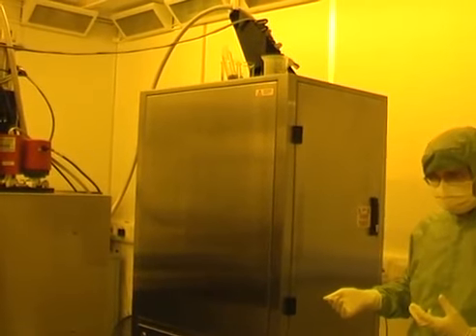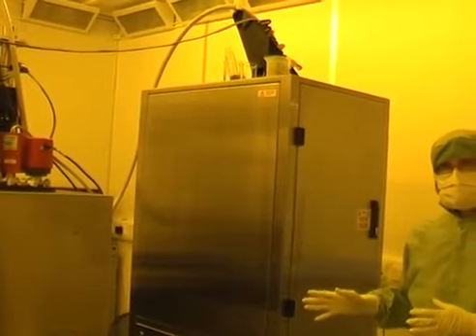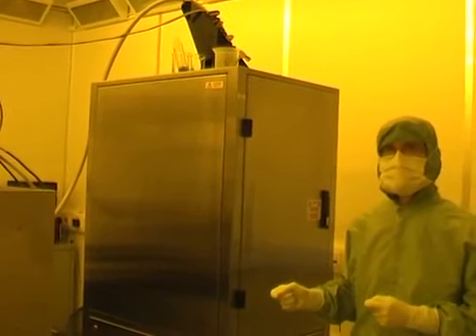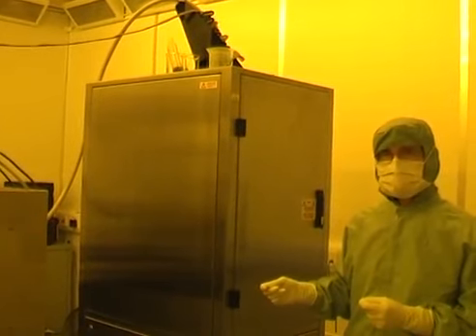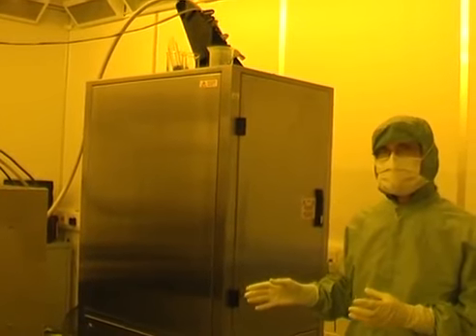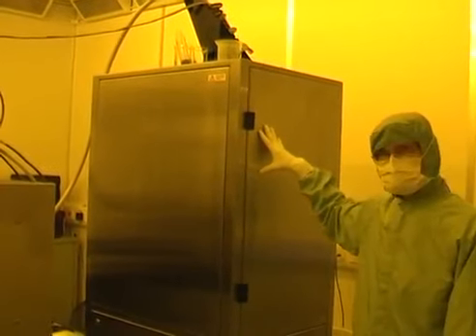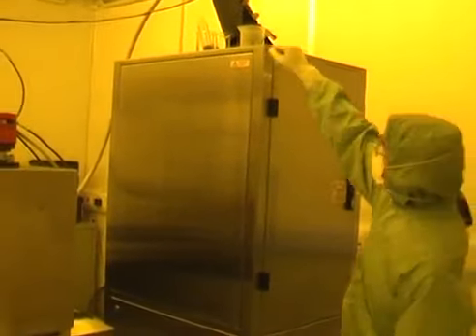And there are 3 different electrodes floating at 100 kV which have to be controlled precisely to one part in about 10 to the 5 in order to keep the performance steady. So that's all done here in the so-called hot box. At the top of the hot box you can see the HT cable, the big fat cable, coming out and coming through to the gun on the left here as I'm pointing.